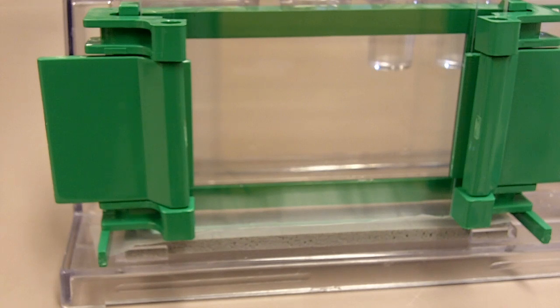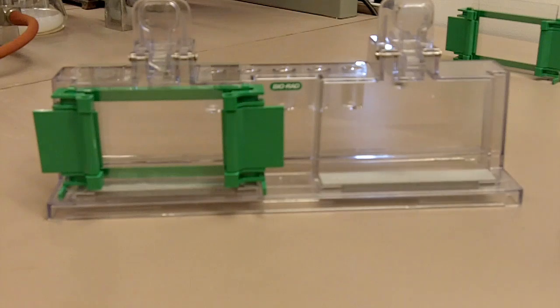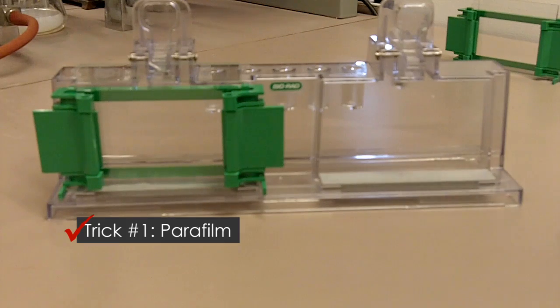So like that. What the parafilm does is it actually provides a better seal on the bottom. And therefore your gel won't leak. And now you can go ahead and pour the gel in.